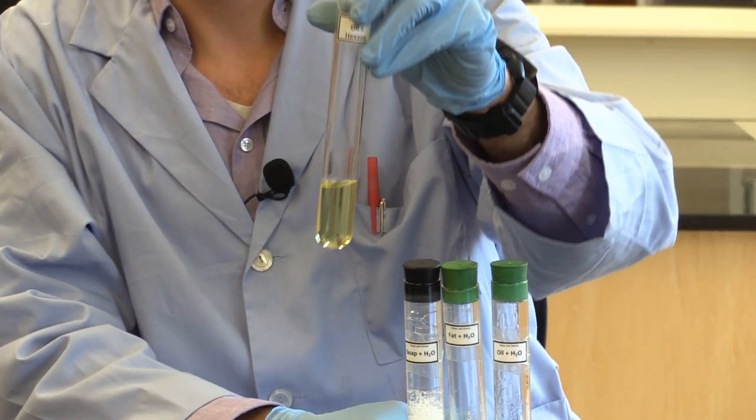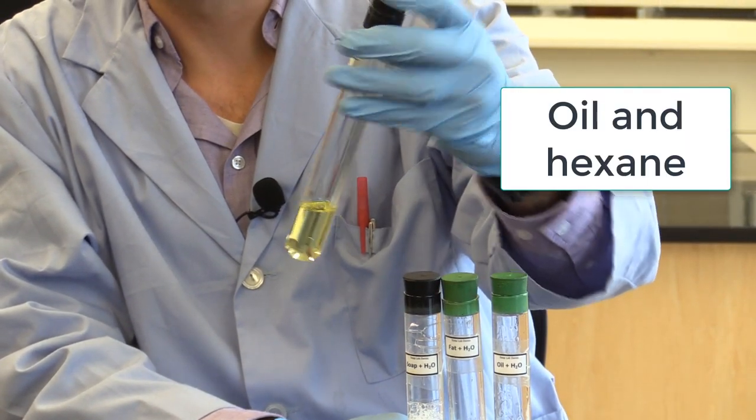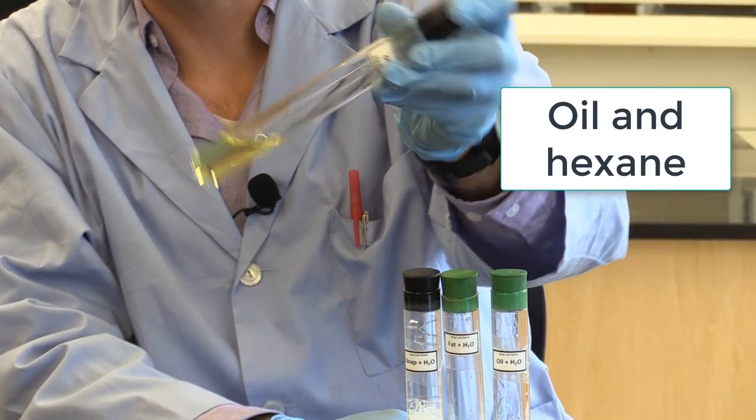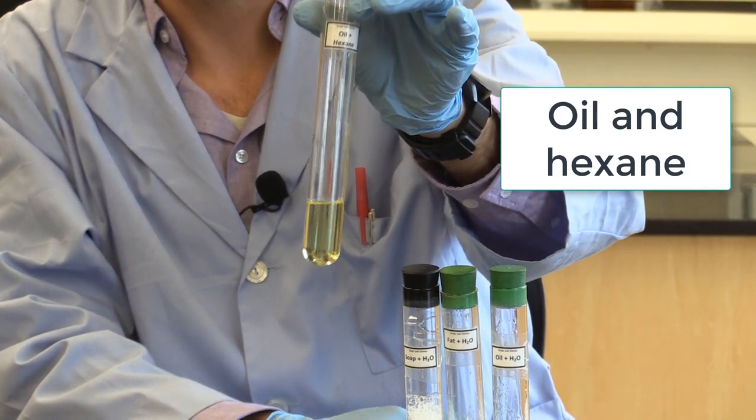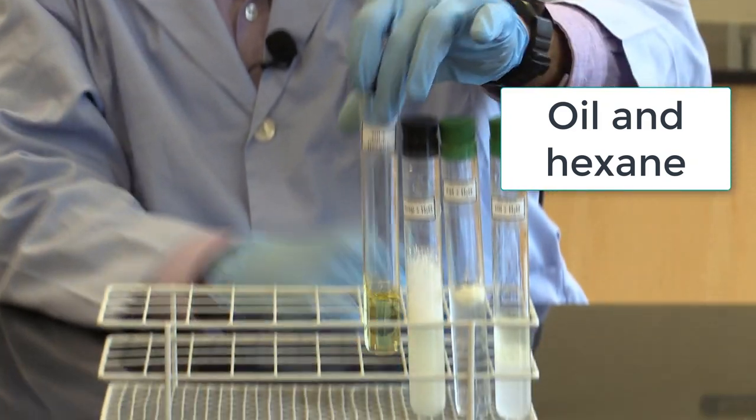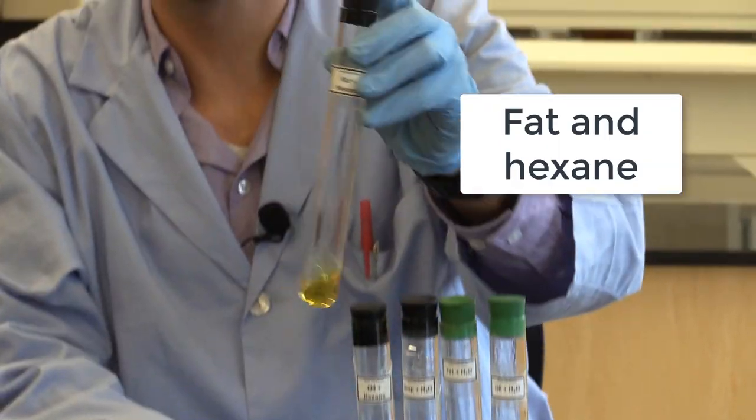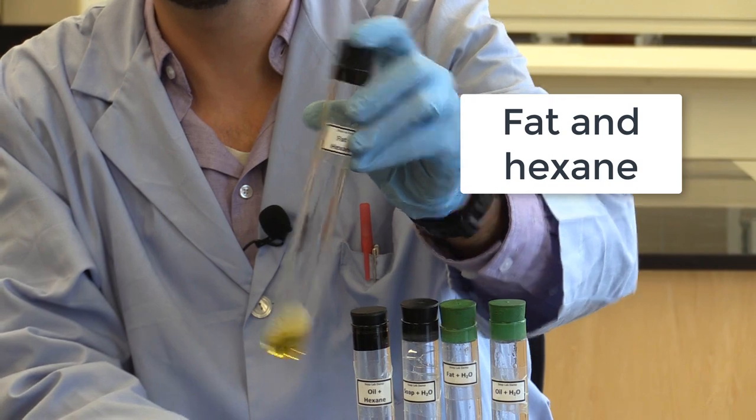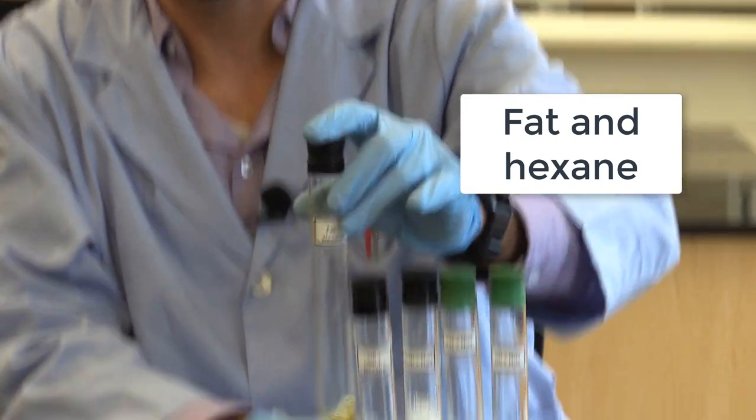As you can see, with our oil and hexane, it is now soluble in that it has a yellow color. The fat, which is not soluble in water, is now soluble in the hexane.